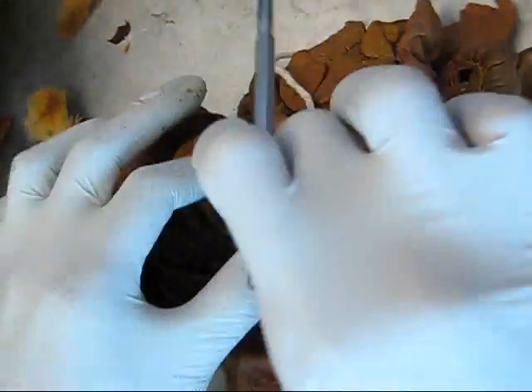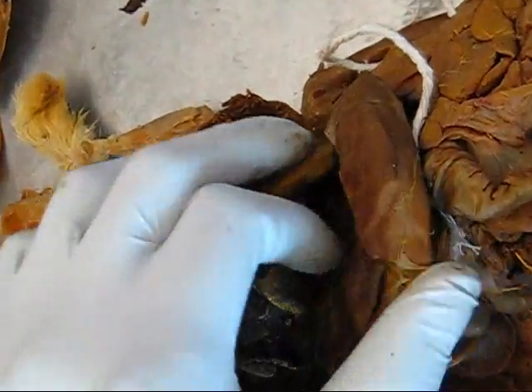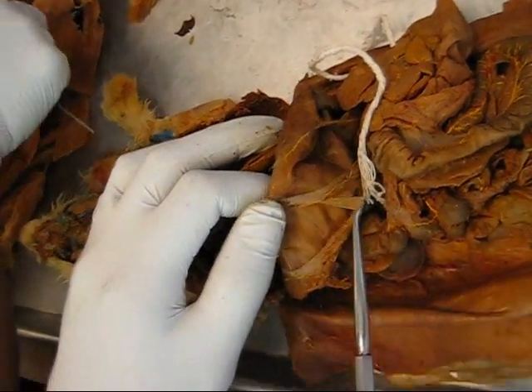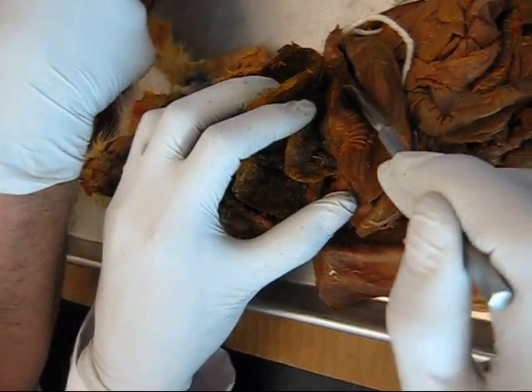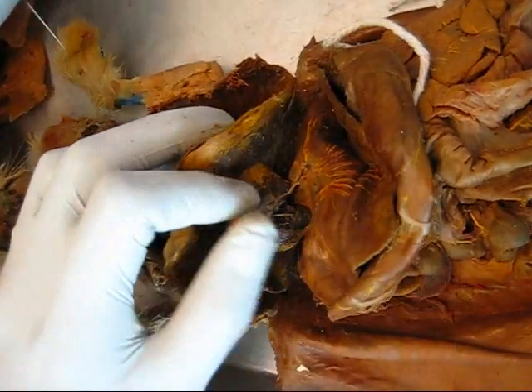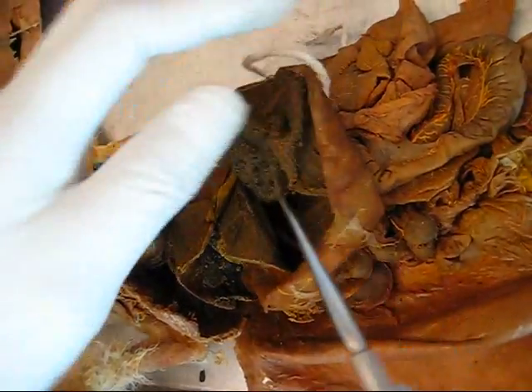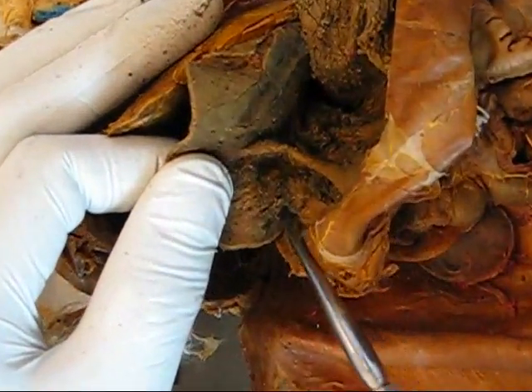Stomach. This is the stomach. Greater curvature with greater omentum — here's the greater curvature. Lesser curvature with lesser omentum — lesser curvature is on the superior portion. Gastric rugae — it's on the inside. Pyloric sphincter here, the opening.